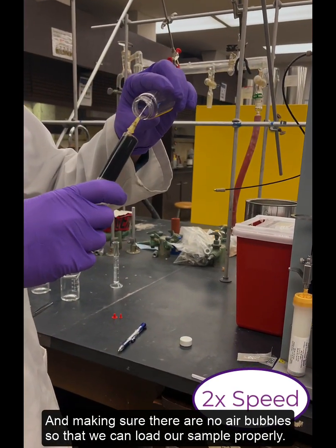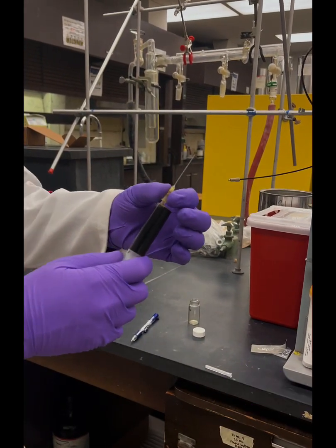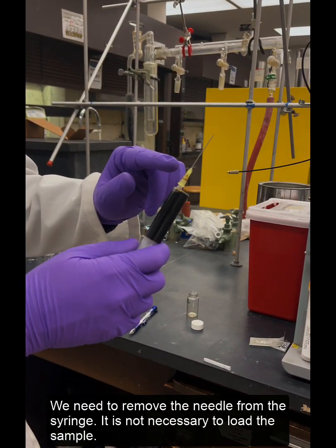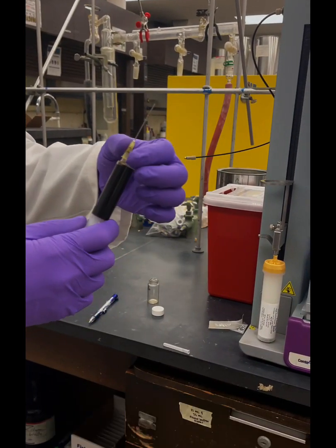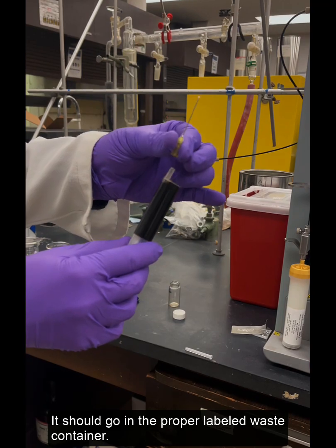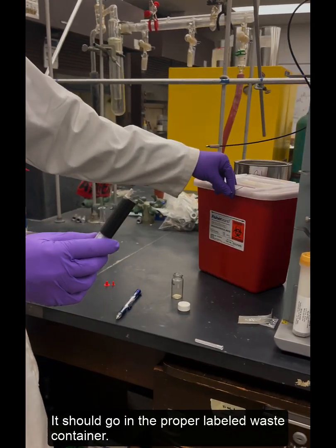We need to remove the needle from the syringe since it's not necessary to load it into the column. It'll go in the properly labeled waste bucket.